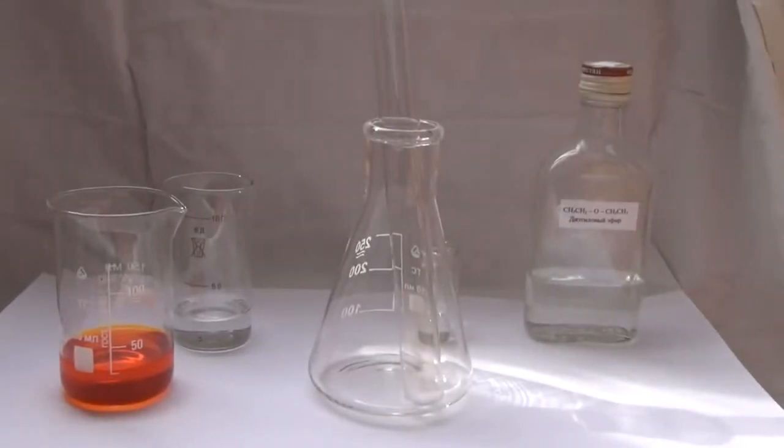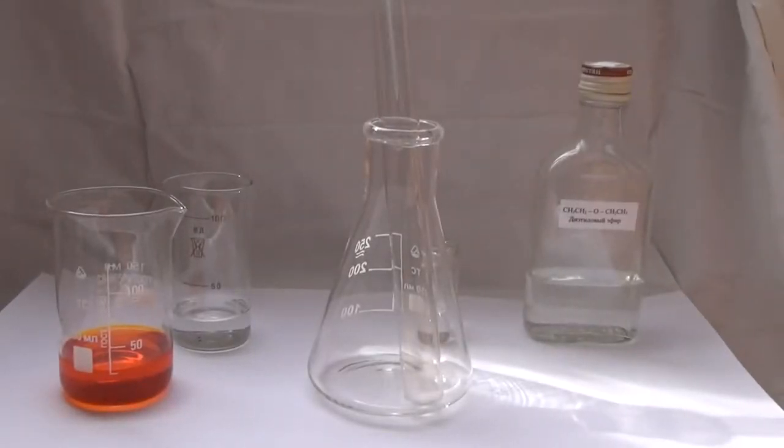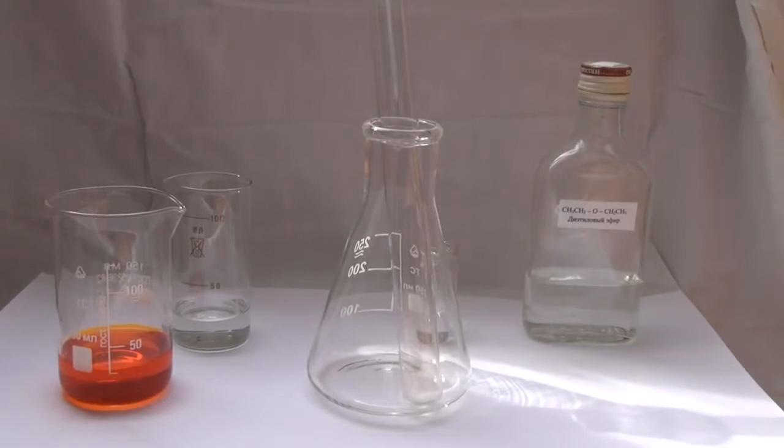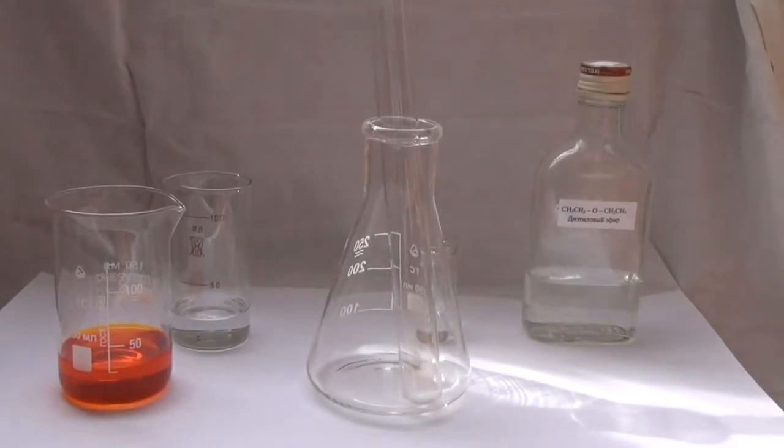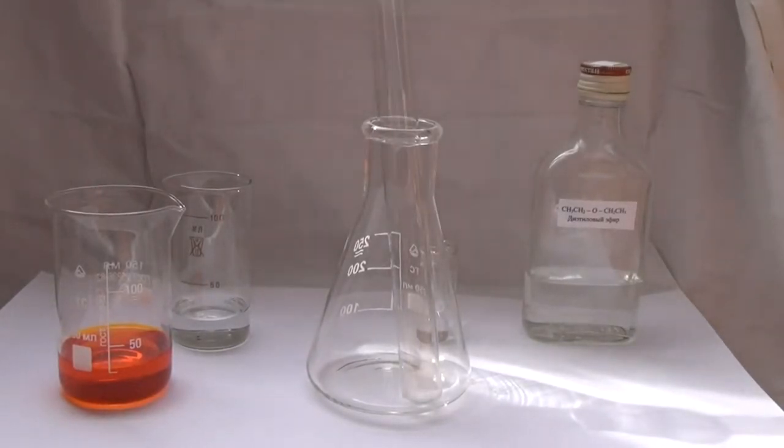Hello everyone! Today we will conduct an interesting experiment, which is called a three-layer colored liquid.